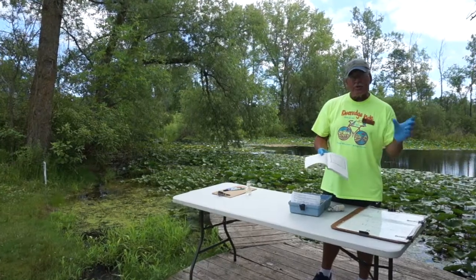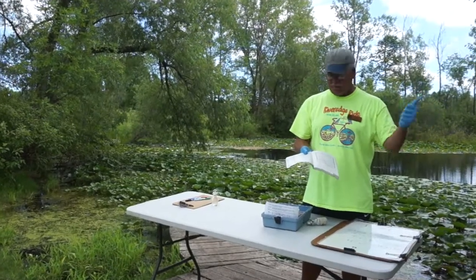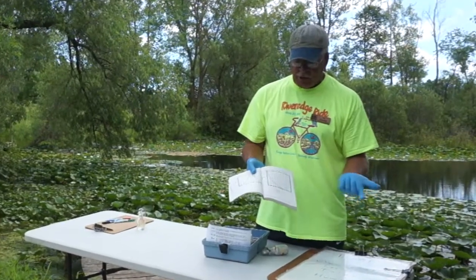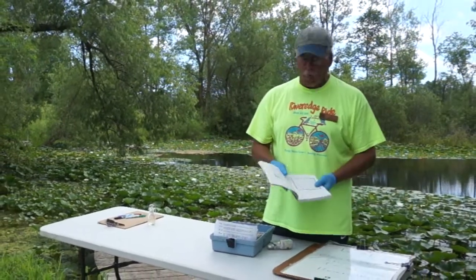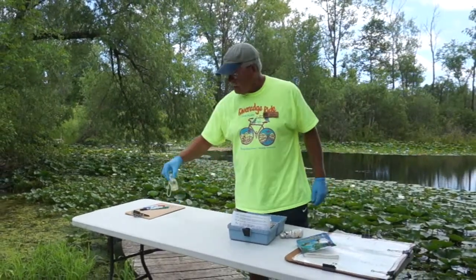Let's say that you had done the 2 tests and you got 12 milligrams twice. You subtracted and you got 0. Well, 0 would be a perfect score. You'd be up here and you get 100. Let's say, for instance, you measured and you only had 2 milligrams per liter. You lost 10. Wow, we get a horrible score between 30 and 40. That's what we're measuring here. We're trying to measure how much organics was in this water.